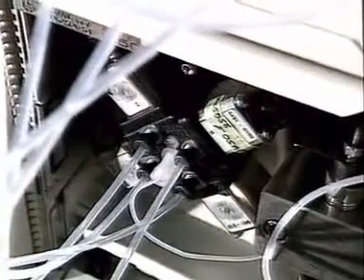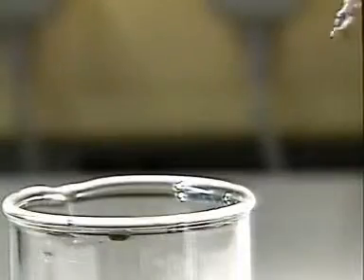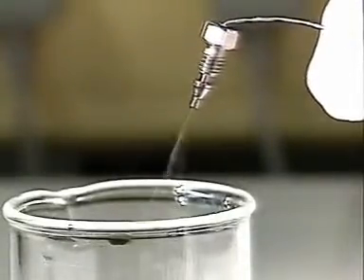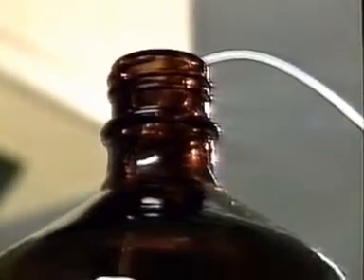Dissolved gases are removed from the solvents and pumps force the solvents through the column. The pressure difference across the column is about 13,000 kilopascals. This is the flow of liquid directly from the pump. The rate of flow through the column is set at 1 cubic centimetre per minute.